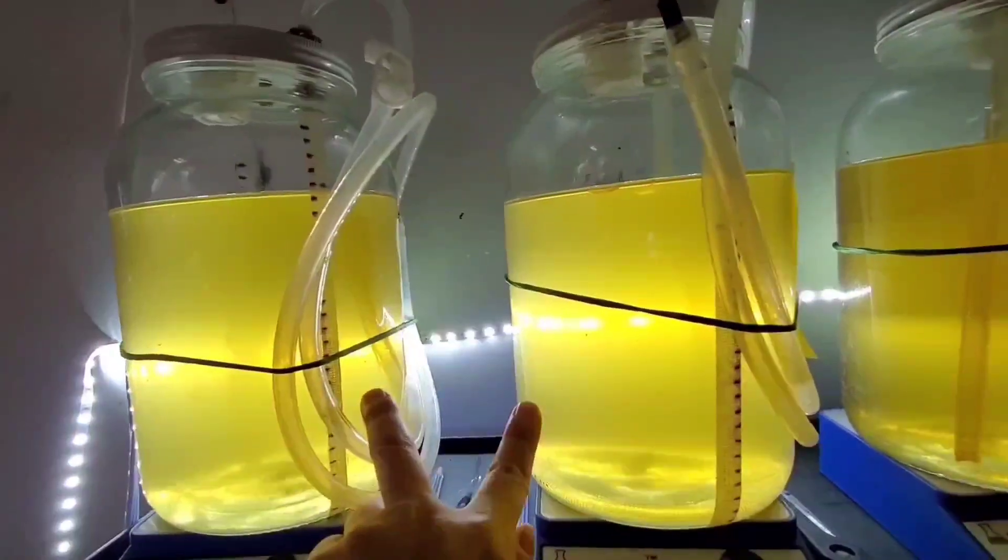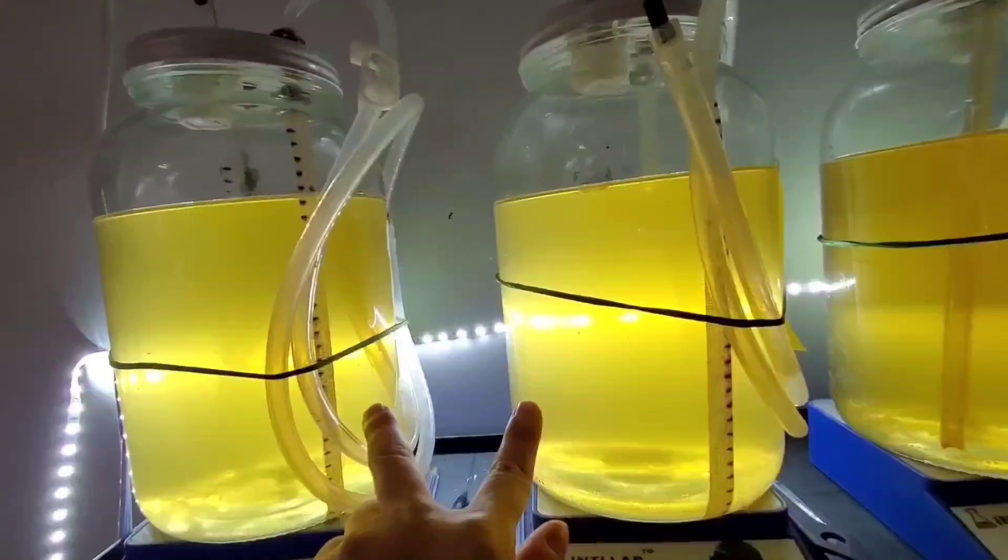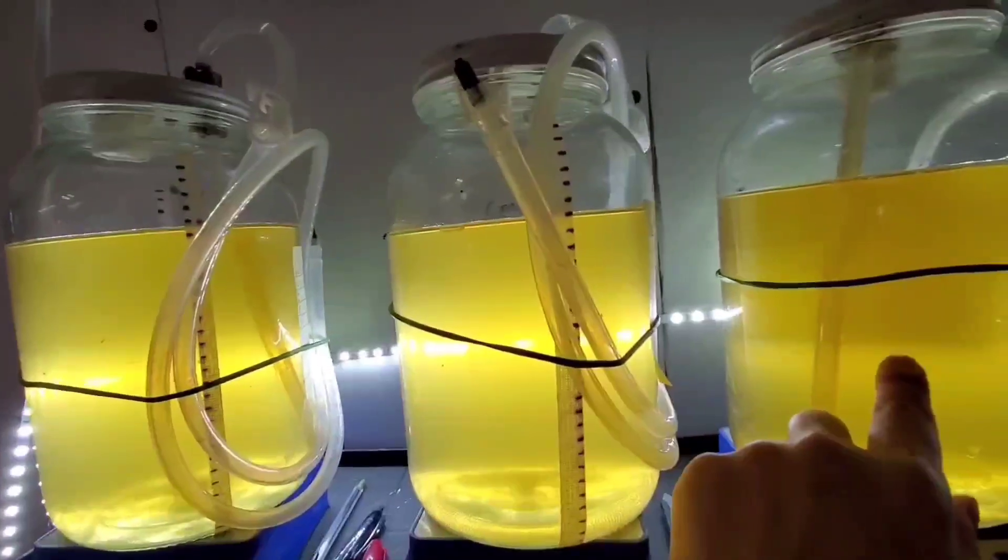These two I inoculated yesterday. They are both variegated cordyceps from Terrestrial Fungi. I'm so excited about it. And then this one is what I just did.